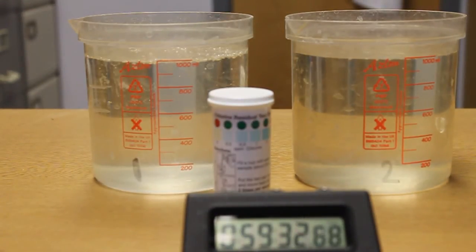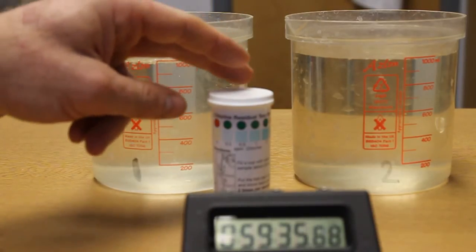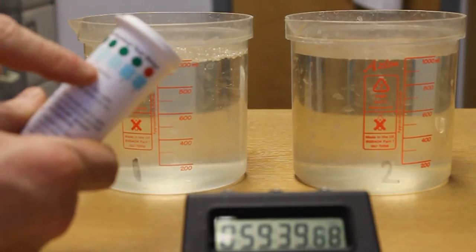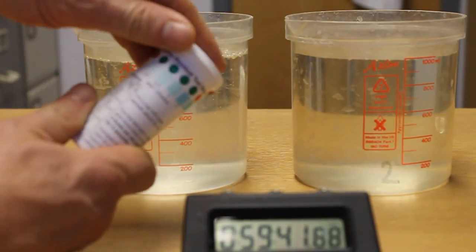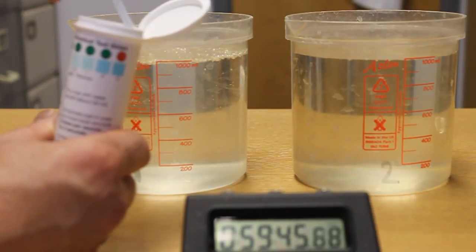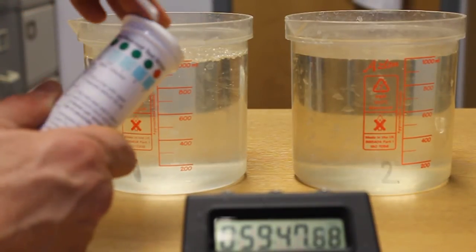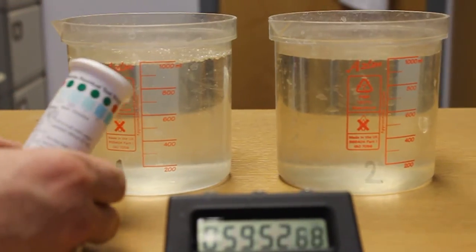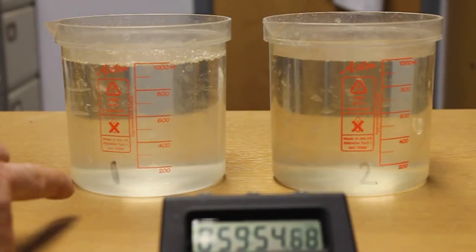After one hour, test using the chlorine test strips. Test strips have the colour indicator on the side, open the tub and remove a test strip. Now we are up to about one hour. So we will test the first sample first, which was the one with one tablet.